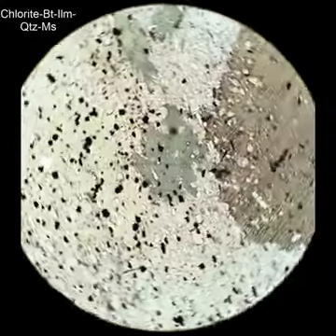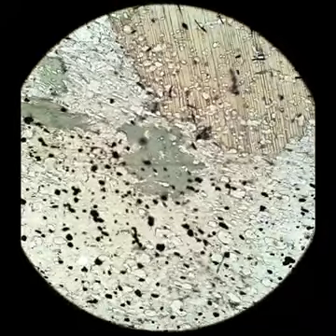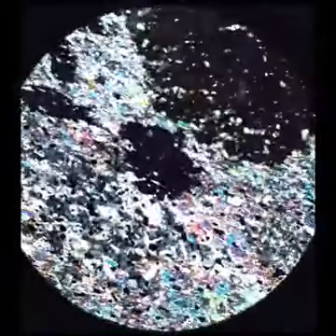Here's more chlorite, but now the flake is oriented parallel to the surface of the thin section. So you're looking down on a cleavage plane there. And as a consequence, the halos, radiation damage halos, are not pleochroic. And when you cross the polars, it is pretty much just black. So that's also chlorite. It has a distinctive green color, but in this particular orientation, it doesn't have the same pleochroism and interference colors.